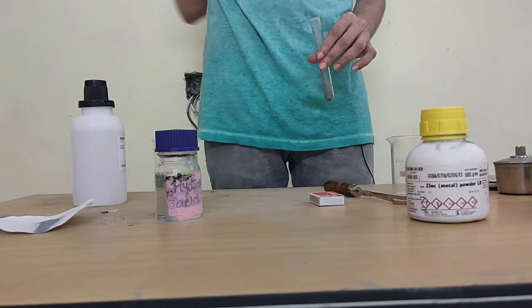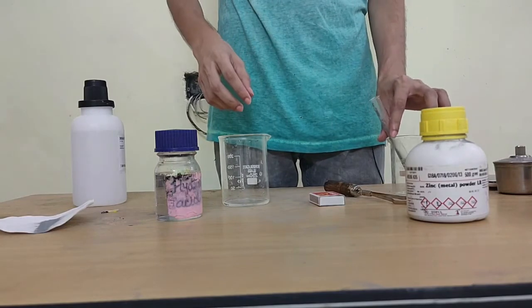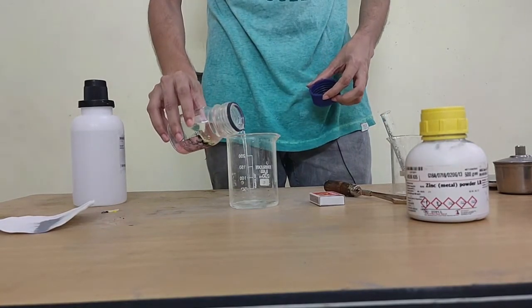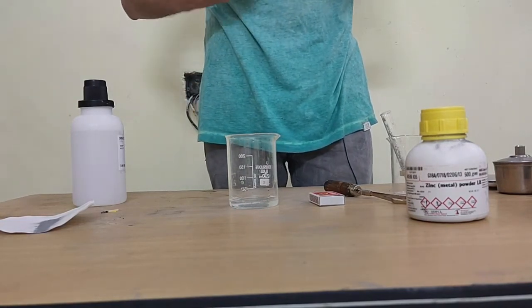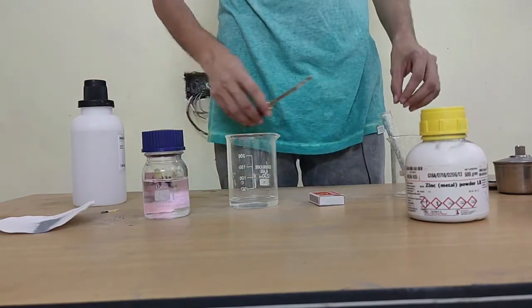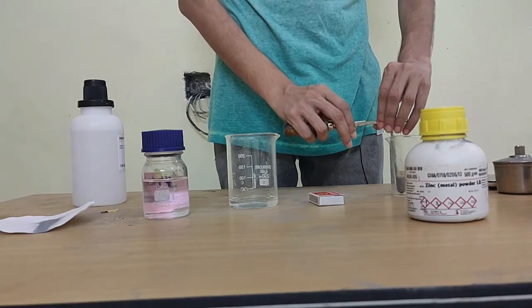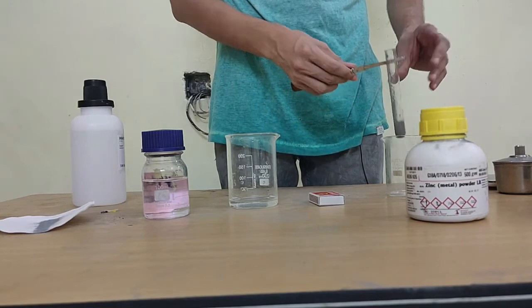Now the next thing I need to do is add the acid inside of the test tube. Now here I already have some acid in the beaker here. I'll just add some more. And you be super careful. Remember, acids are corrosive, especially strong acids, and so are strong bases also, by the way. Just because it's not an acid doesn't mean it is not strong. Base can also burn your skin quite heavily, so you need to be careful. So since I'm starting to use the acid, I'll be using this test tube holder here. It helps me hold the test tube at a distance so that I don't get injured. Okay.